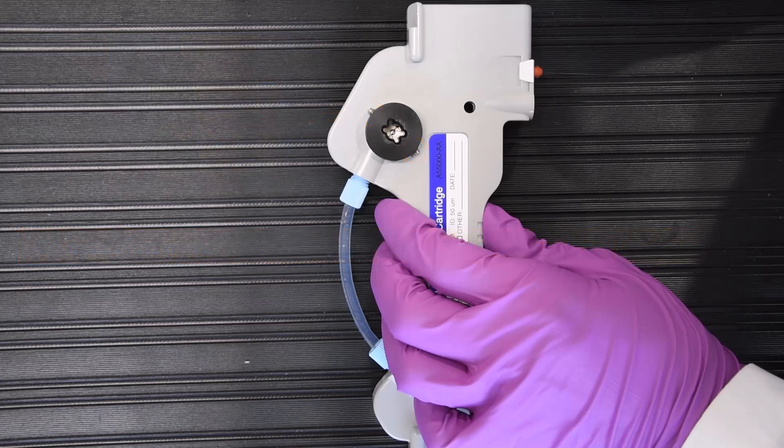After installing your LIF aperture and probe guide, you are ready to use or store your capillary.